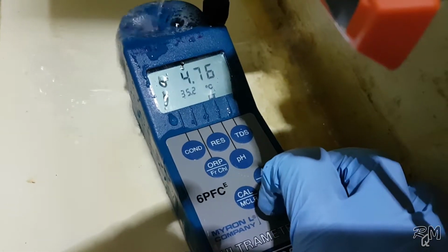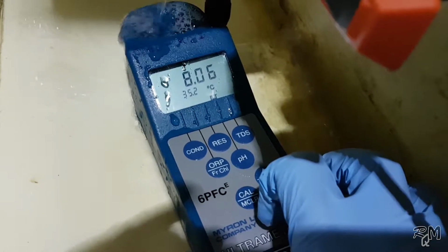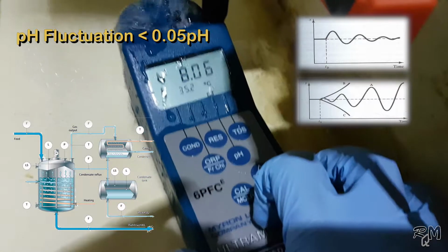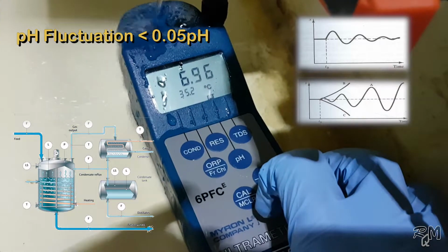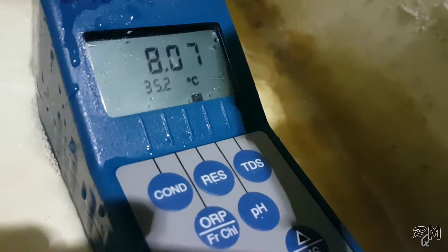For this purpose, keep the standard lab pH meter in the sample stream. For proper process calibration, it is recommended that your process fluctuation should be less than 0.05 pH. I'm not saying that you cannot perform process calibration if fluctuation is more than 0.05 pH. Still, you can perform process calibration, but it is difficult to get accuracy in this condition.